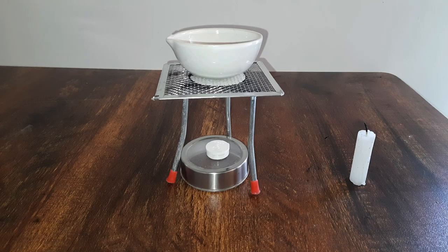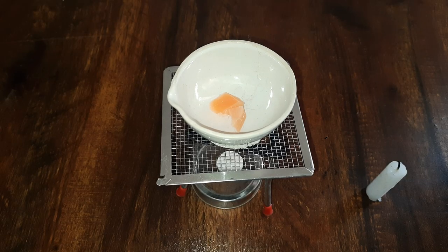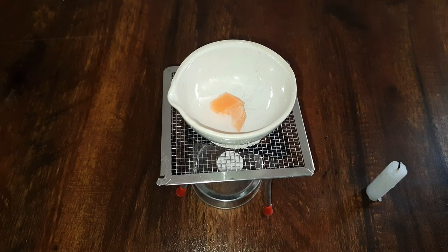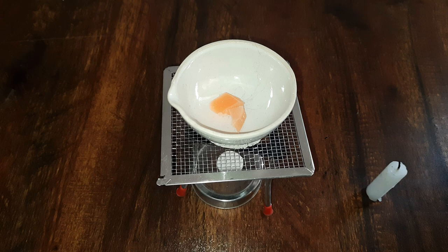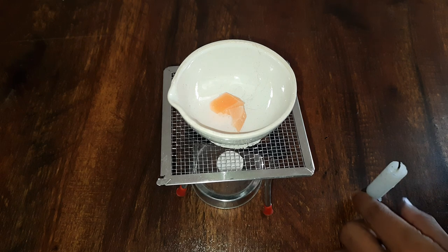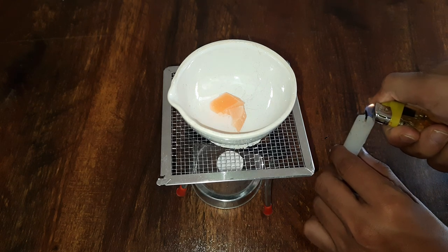I have a porcelain bowl kept on top of a wire gauze and tripod stand. Inside the bowl there is some wax, and I will heat the wax from this candle and let it melt.